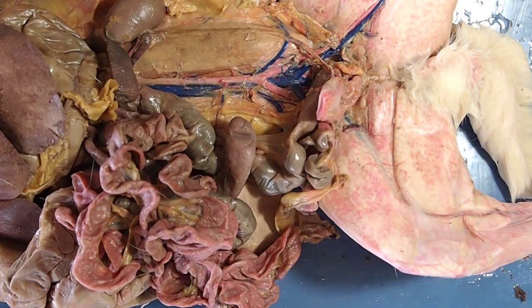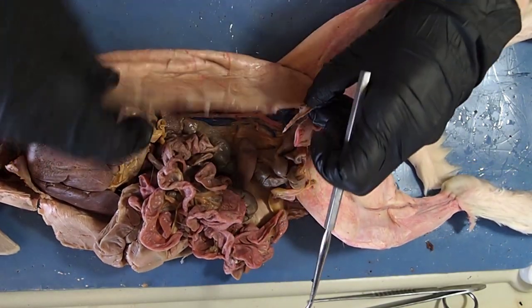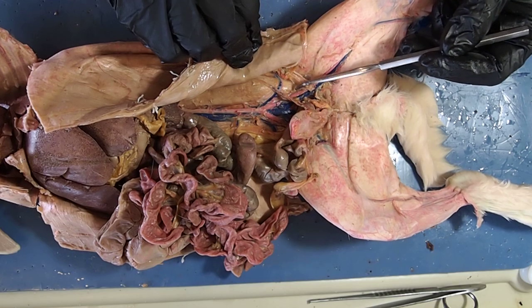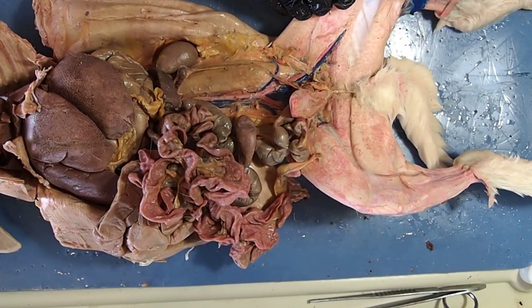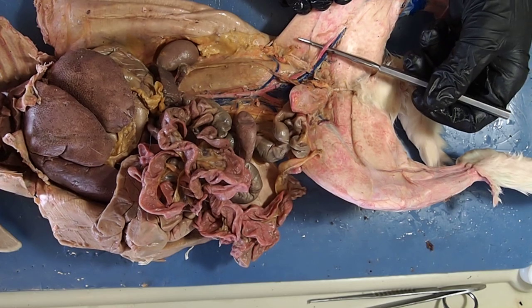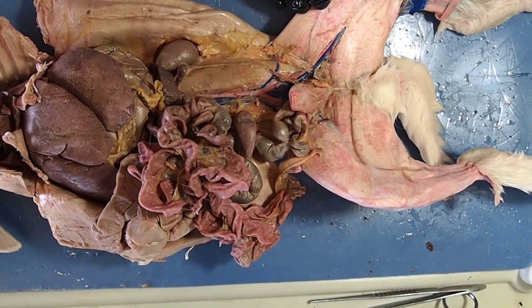Continuing to branch down to the legs, I want to point out one last pair of blood vessels — an artery and a vein — that you're probably familiar with. Here's the abdominal wall. When these vessels come out into the leg, we no longer call them the external iliacs; they get a new name. The red vessel coming out into the leg is your femoral artery, supplying the lower leg with oxygenated blood. The femoral vein drains the leg of deoxygenated blood and rejoins my inferior vena cava, going back to the heart. As a quick note, if the femoral artery is cut due to trauma or surgery, you can bleed out and die in a matter of minutes.